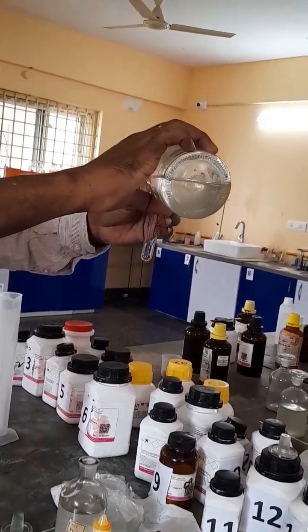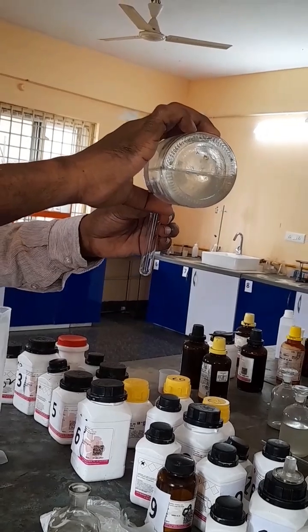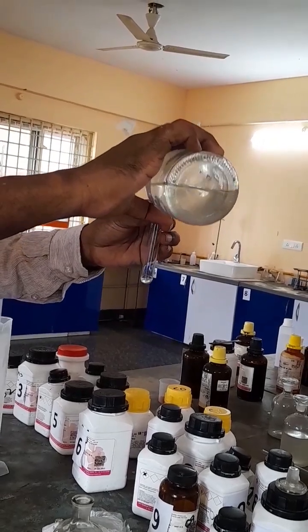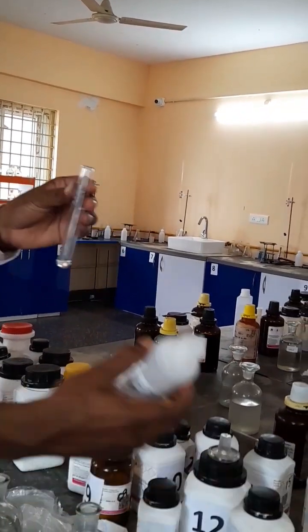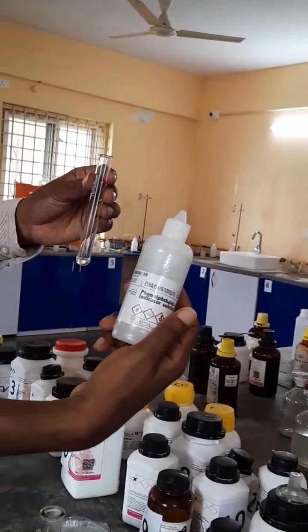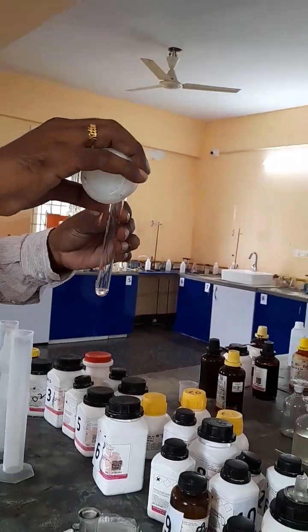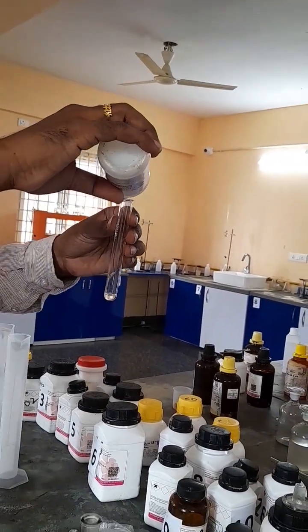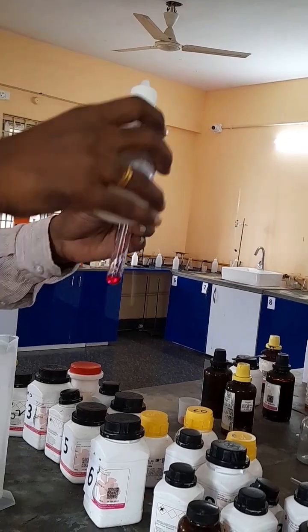I am going to add an alkali — this NaOH solution — a small amount taken in a beaker. I have taken phenolphthalein indicator and added one drop.